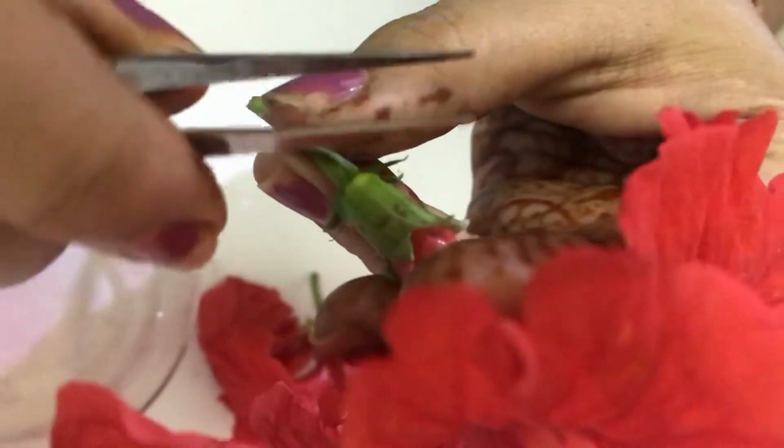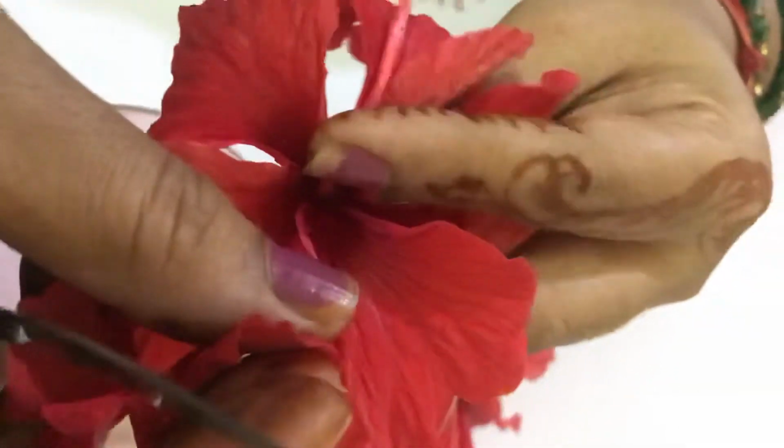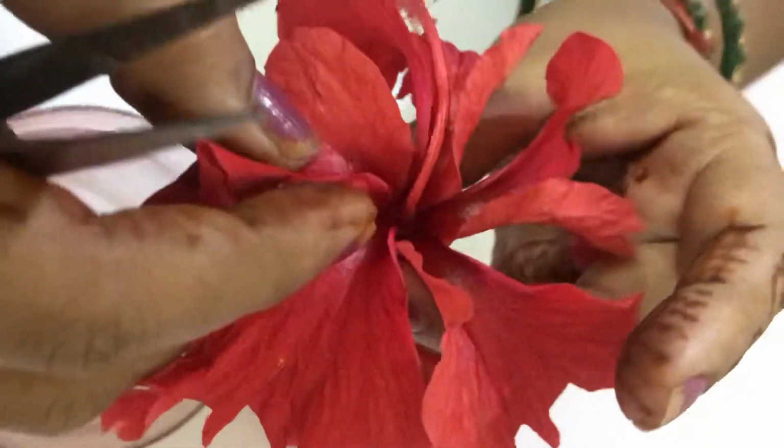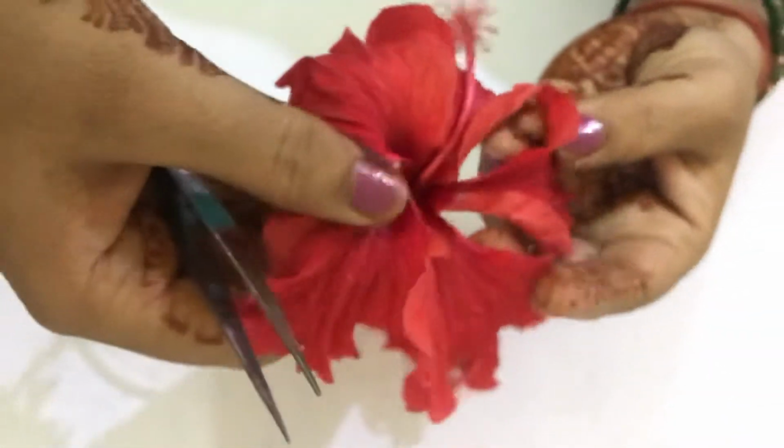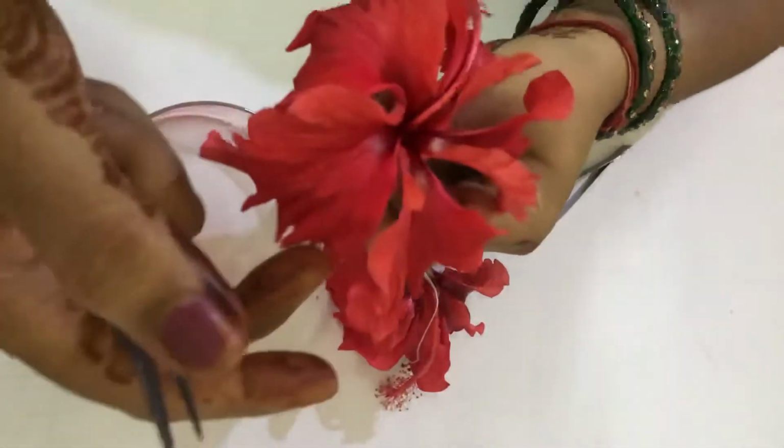In the case of petals, you can see that one side of the petal is above the second one, one side outside, one side inside. So this condition is termed twisted estivation. For the sepals the condition is valvate, while for the petals it is twisted estivation. The group of petals, you already know, is the corolla.